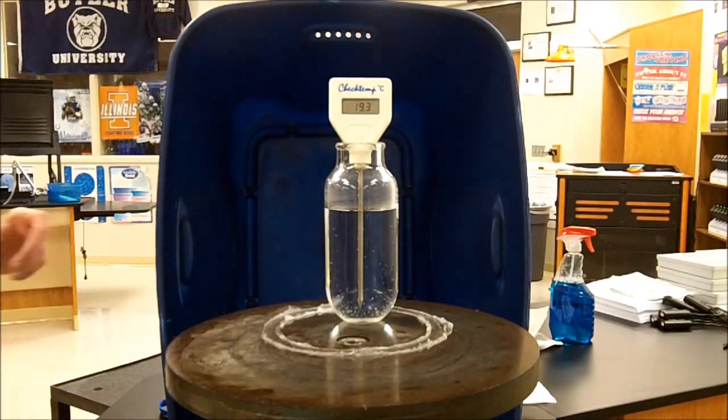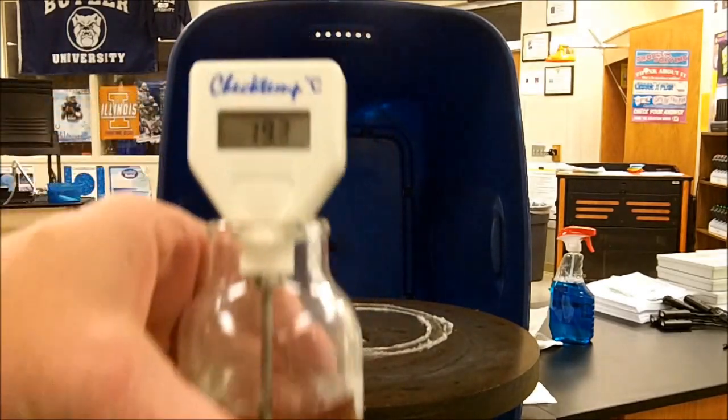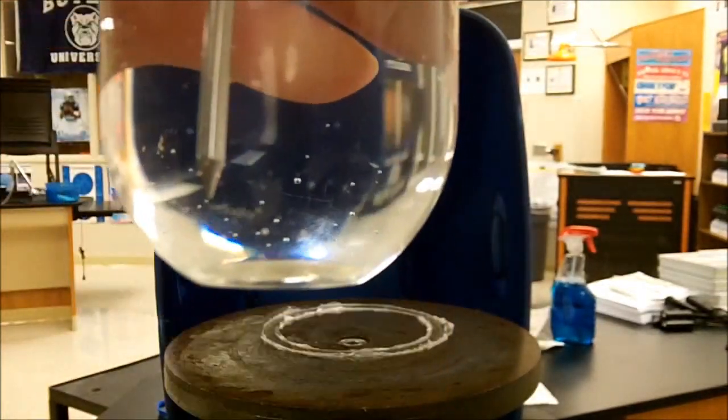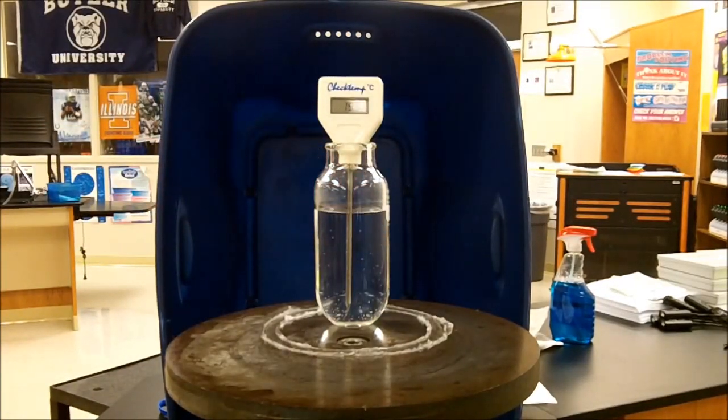And now that the pressure inside and outside of the container are equal, I can simply lift that off. Now what's cool about this is, the temperature in this is actually cooler at a 19.3 degree temperature. Again, this is just regular old tap water. But there's your demo of having water boil at room temperature.